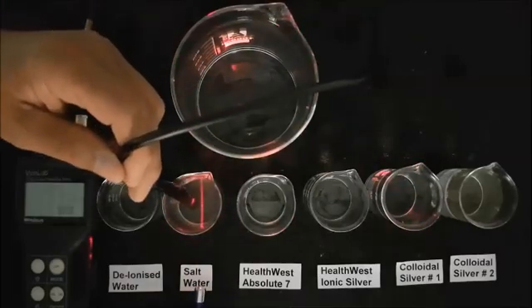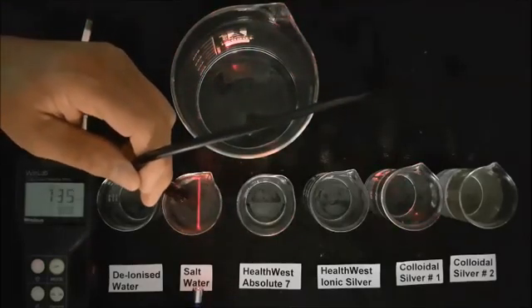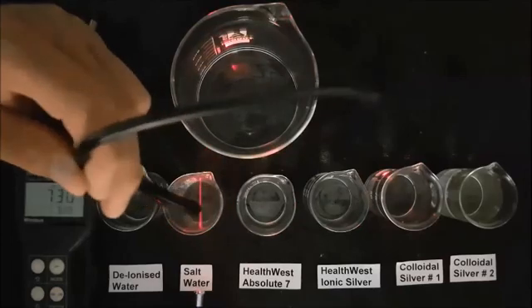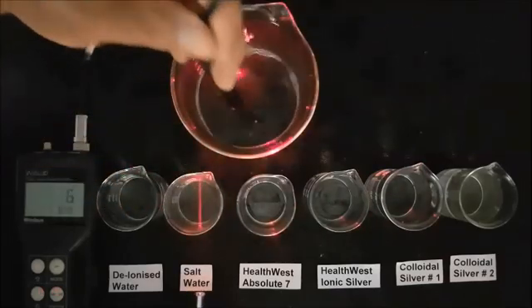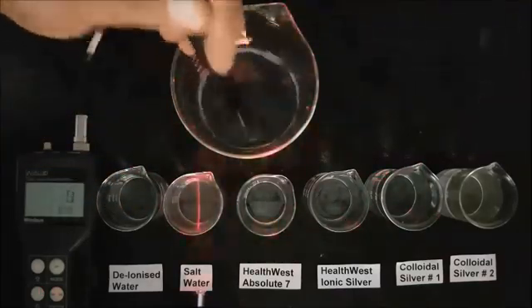In this case salt, with a conductivity of over 700 parts per million. You can clearly see the beam as it highlights all the particulate matter in the beaker.